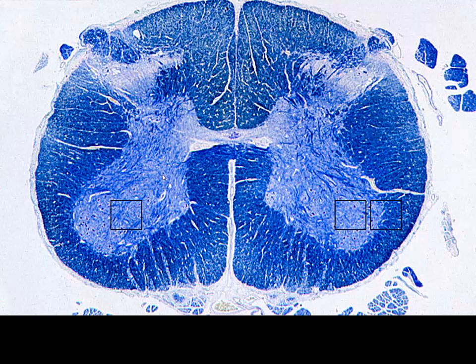Now, looking further, we are now in spinal cord. We can see our white matter and gray matter, and it's almost like an X-ray or a negative image, because the white matter is darker in this particular image, and here we have the gray matter on the inside. Here we have our commissure, dorsal horn, ventral horn. This is where we have sensory input, and this is where we have motor output with our motor nerve cell bodies.